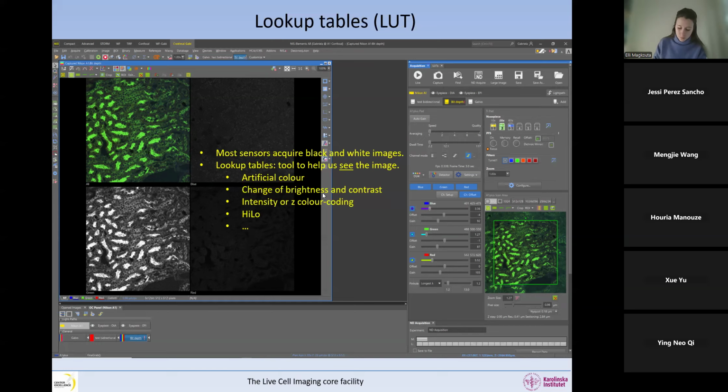You have practiced this already. And we can color code the intensity, for example, or the Z level. We can use high-low, which you have used, so the saturation and underexposure mask in Fiji. So all these are lookup tables. It only changes how the computer displays the data. The data is not modified, so it's very nice. It means you can work with lookup tables on the original image, and you can reset that afterwards. It's only a display.